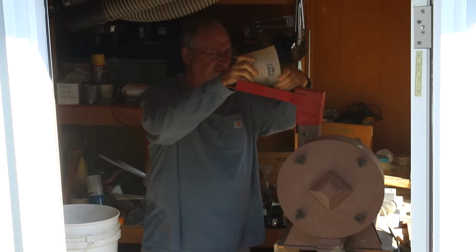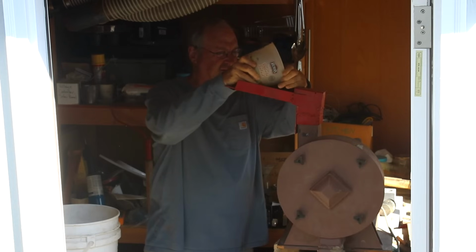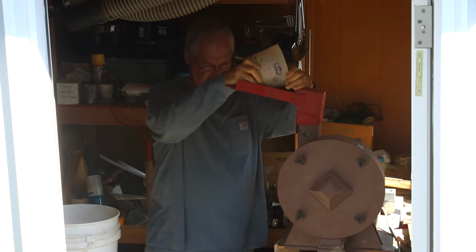So I didn't even try to talk over this. The noise from the mill was so loud, you wouldn't have been able to hear me clearly anyway. So I thought I'd just do a narration over the top of it. And that way you could see what I'm doing and I could tell you a little bit more about it.